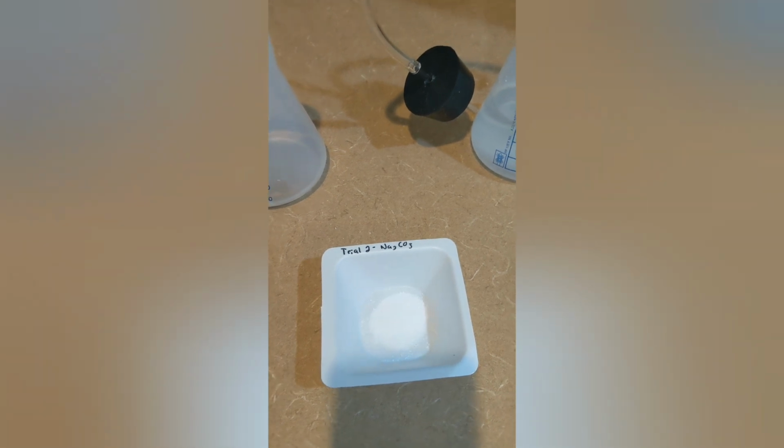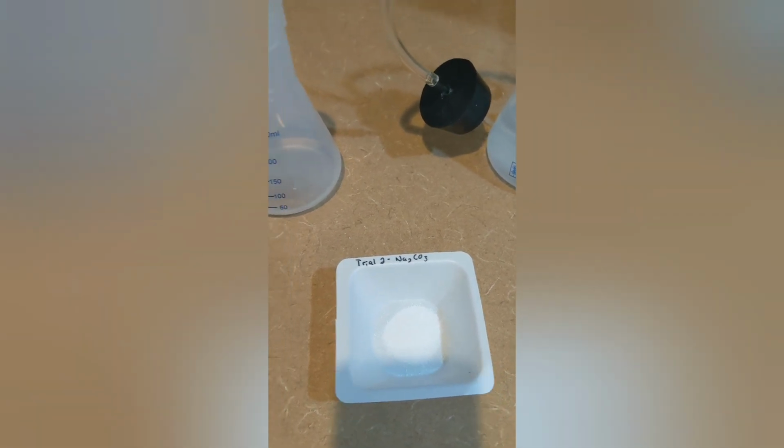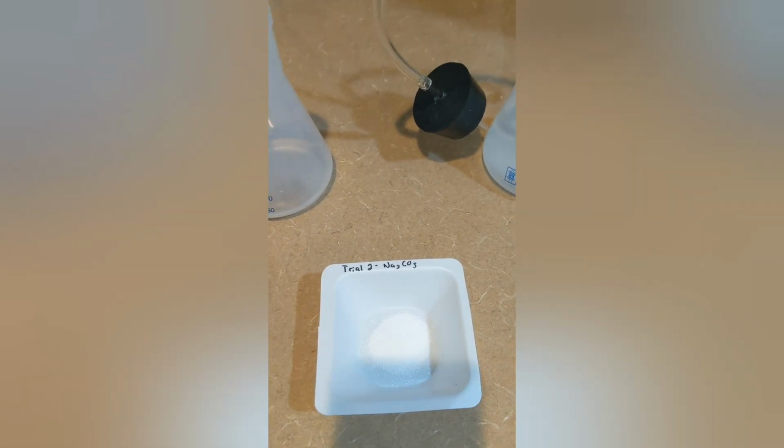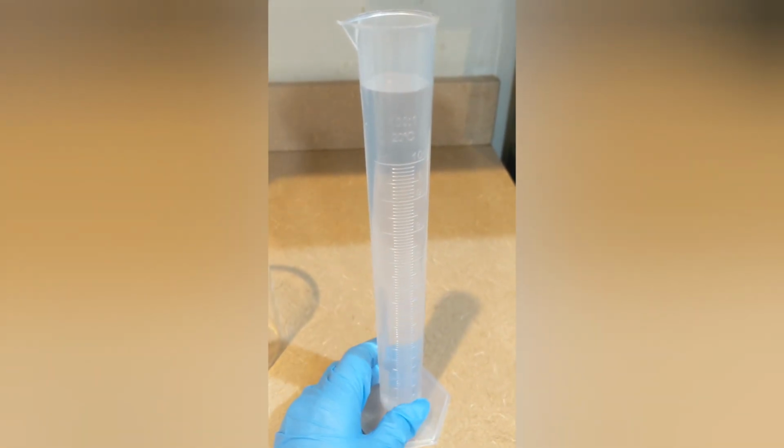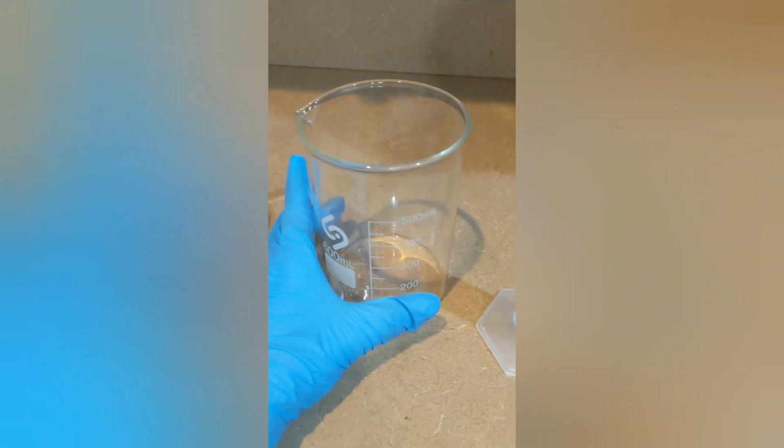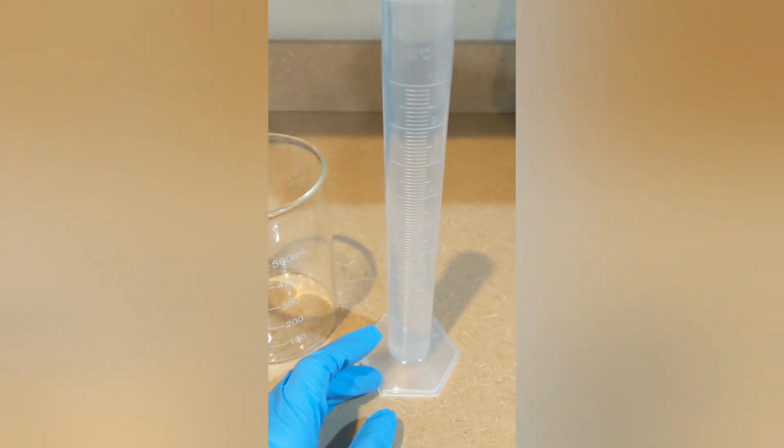And now I will perform the second trial using the reaction of acetic acid with sodium carbonate. Trial 2 for sodium carbonate produced way different results. Whereas the first time I couldn't get any water to displace, now I have more than what we can measure in the graduated cylinder. So what I'm going to do is pour out the excess into this clean glass beaker, measure the 100 milliliters, and then pour that out and then measure the excess to find out how many milliliters was displaced. So we have 27 milliliters of excess, which means that in total there were 127 milliliters of water displaced.